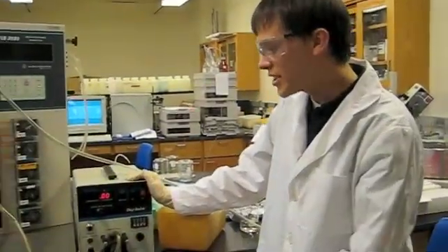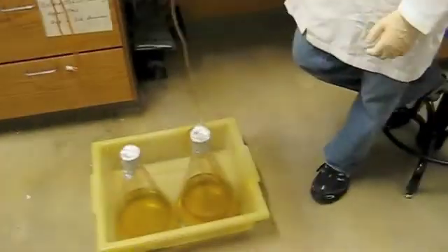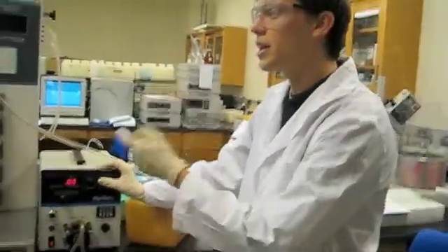Okay, so we've sterilized our tubing, and as you can see it's in our media, and we're going to start up the peristaltic pump and pump our media into our vessel.